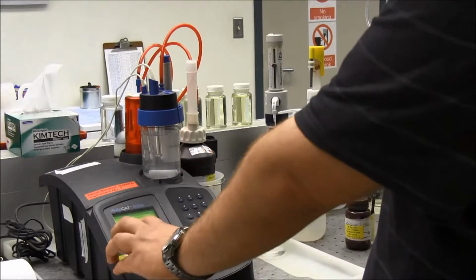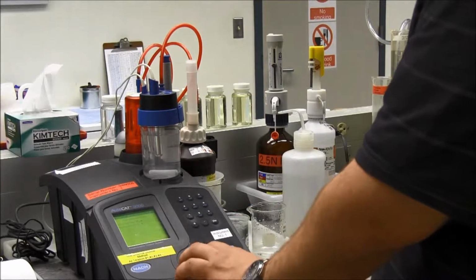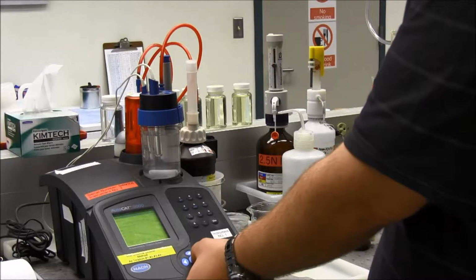And my first cursor is actually in a pretty good spot right there. I have a nice even line all the way down, so I'm going to leave it right there. I'm going to hit the check mark for OK. I have a nice long straight line on the bottom again, which is good.